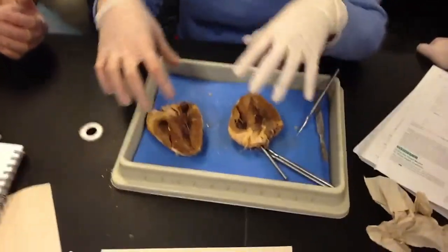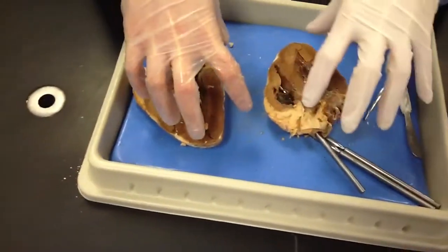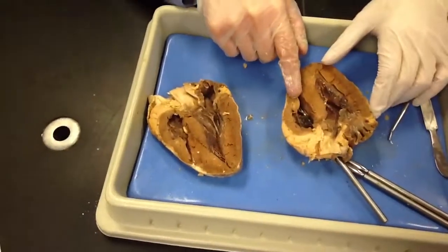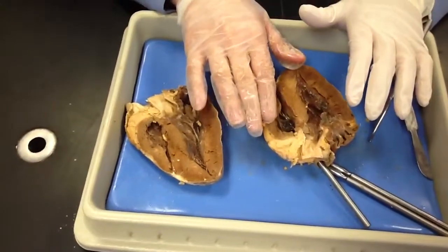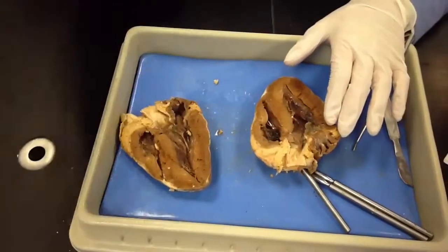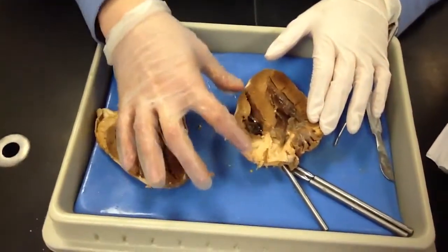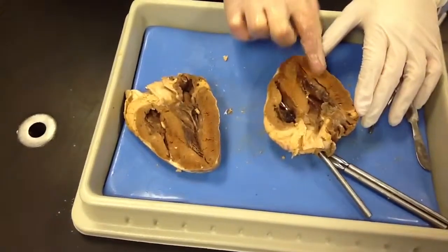So it's really easy to see what blood vessels you need to find when you're following it through the heart, right? So this is the what side? It's the left and the right side. Well, the right side's going to go to what? The right side goes to your lungs. It takes in the deoxygenated blood, right? So it's going to push it out to the lungs. Since it only has to go to the lungs, it doesn't have to be as thick. Oh, gotcha. Yeah, because this has to push it out to the rest of the body.